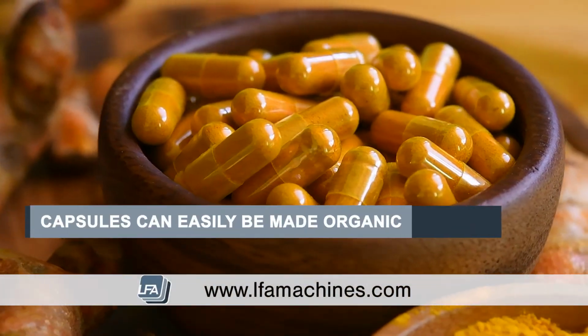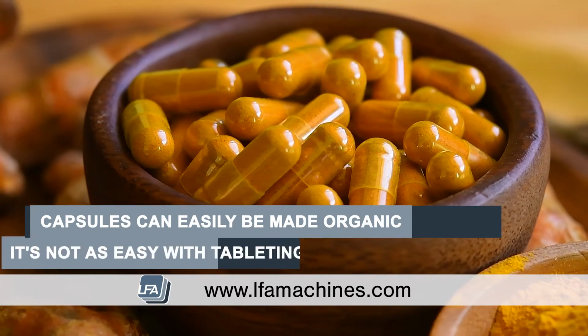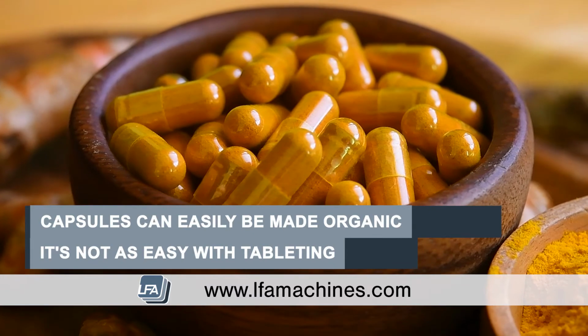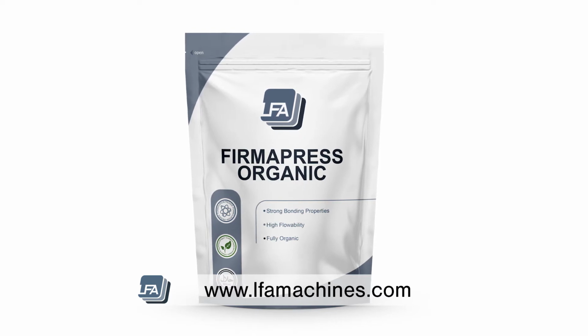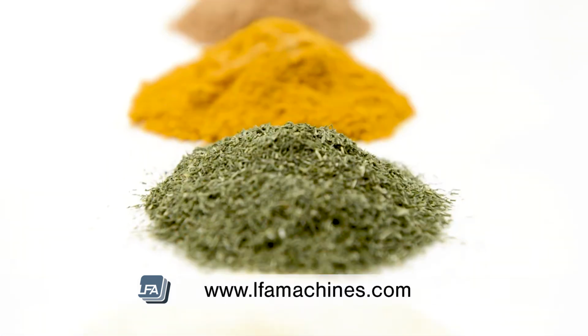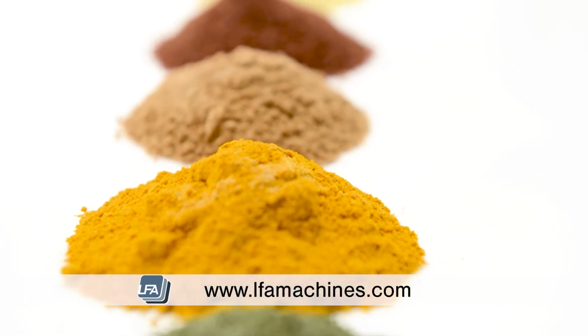Capsules can easily be made organic by purchasing an organic capsule and then filling them with your organic ingredient. However, it's almost impossible to do this with tablets due to having to use excipients for flow and binding, which generally aren't organic. LFA does have an organic tableting binder, but it doesn't work with a wider range of ingredients as standard binders. Both capsules and tablets can have unique combinations of ingredients, allowing you to tailor them specifically to your consumer's needs.